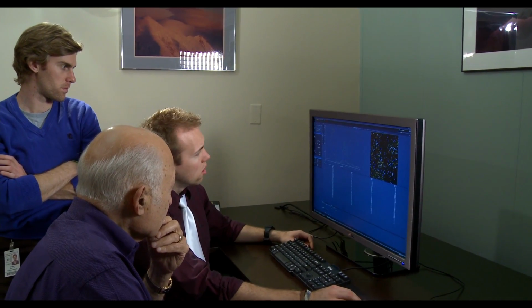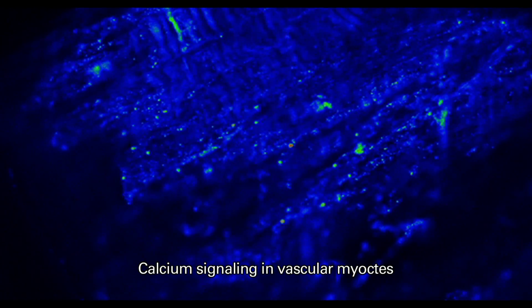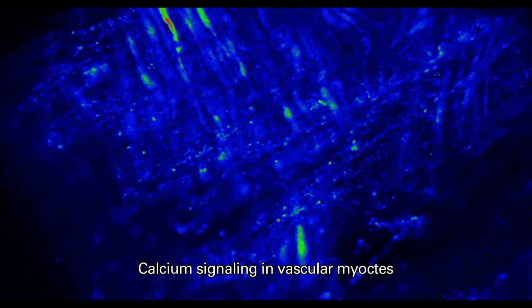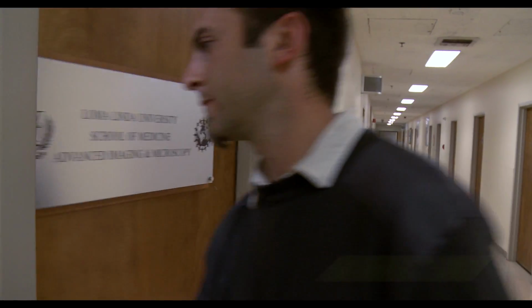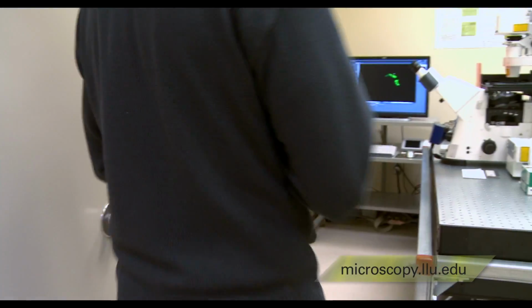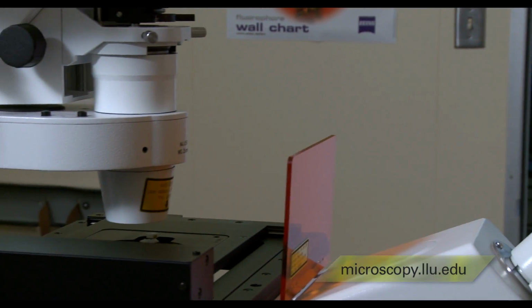What we do in my laboratory is we perform a lot of what we call live cell imaging, where we actually take arterial segments and then we load them with a dye that registers changes in cytosolic calcium. Right away when you look through the scope, you can see whether or not the cells are active because you can see the calcium coming out of the cell. It's almost instantaneous to find out if it worked or not. We prep the tissue in the morning and then we come down and sit at the scope, and if we see activity in our live tissue, then we know it worked.